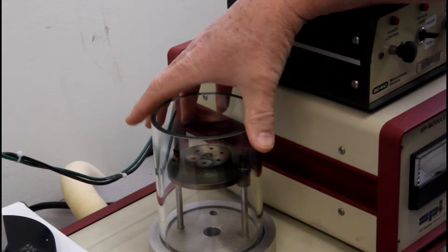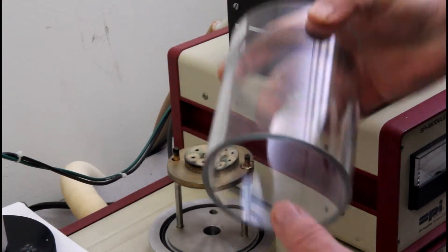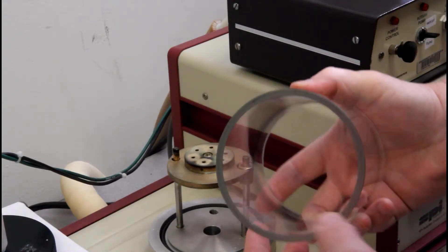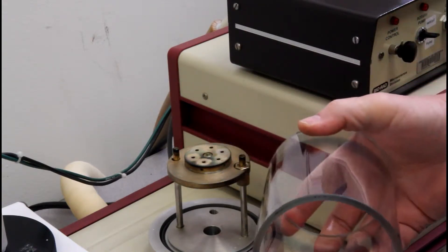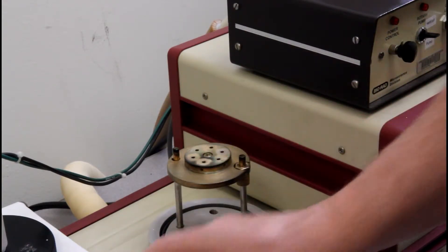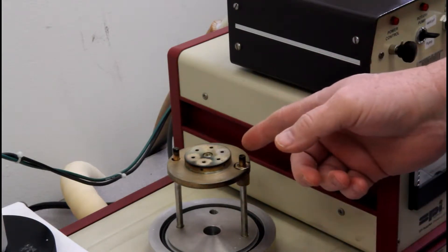The glass can be picked up. Once again, be careful. You can see where there are numerous nicks and chips out of the glass because people were not careful with it. Set it on the cloth, and this is our sample holder.